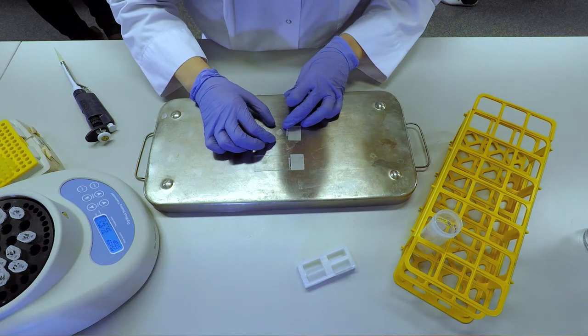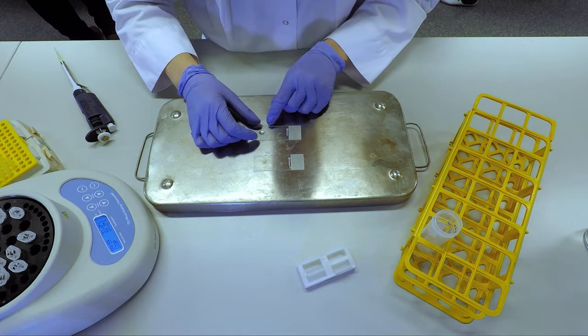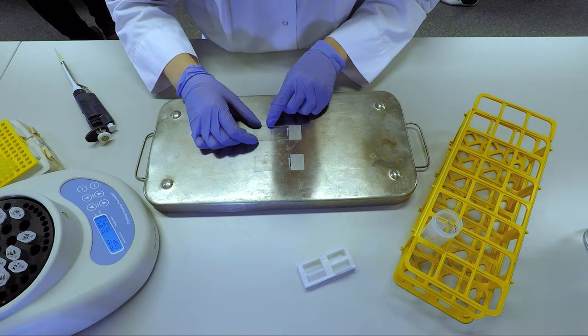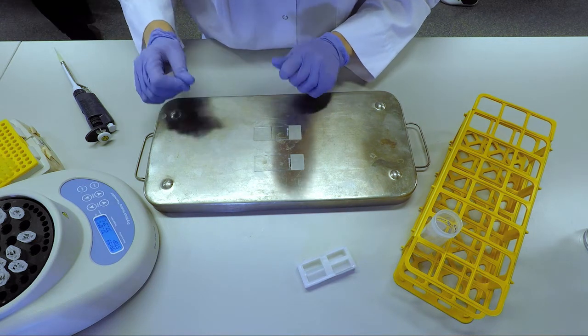Cover the slides with a coverslip and keep it in a metallic tray above an ice rack for 10 minutes to solidify.